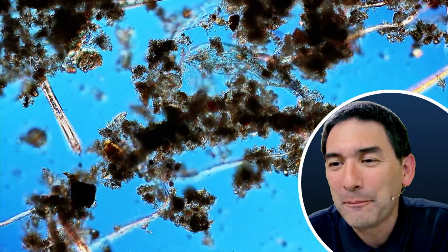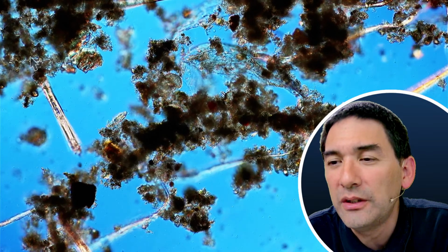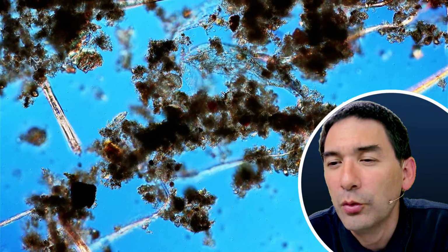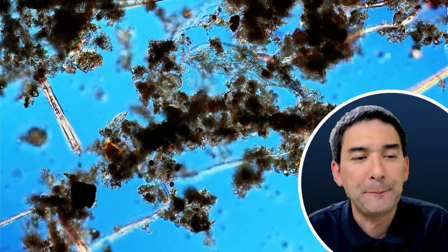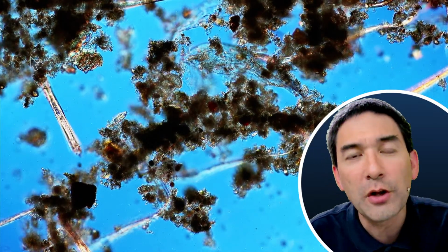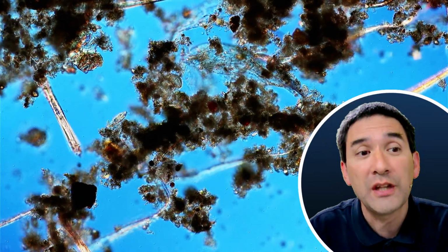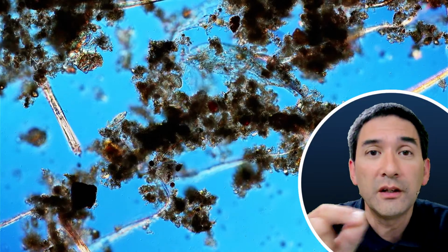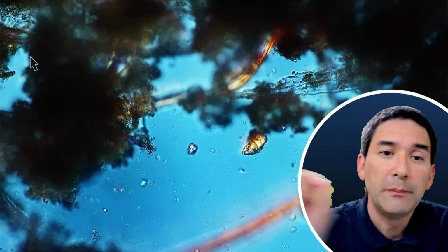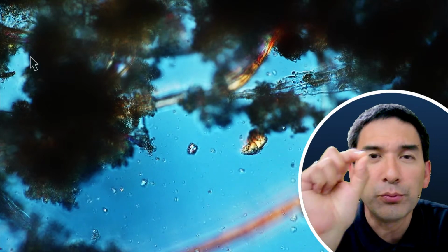Okay, I do want to do the following. Another question: how do you distinguish between organisms moving and Brownian motion? When you see organisms that are actually moving, like bacteria, you definitely know they're moving because they have a much more directional movement. They're swimming across. With Brownian motion, they stay more or less in the same place, but kind of vibrate back and forth.